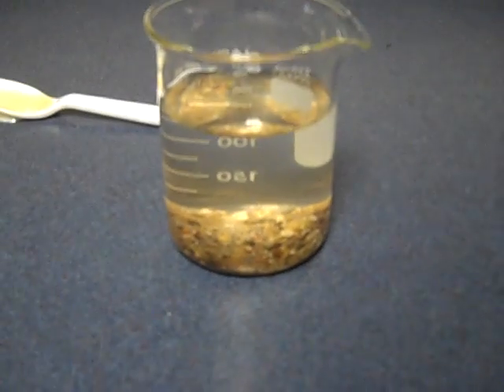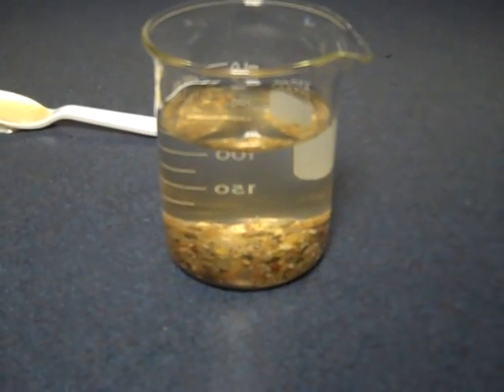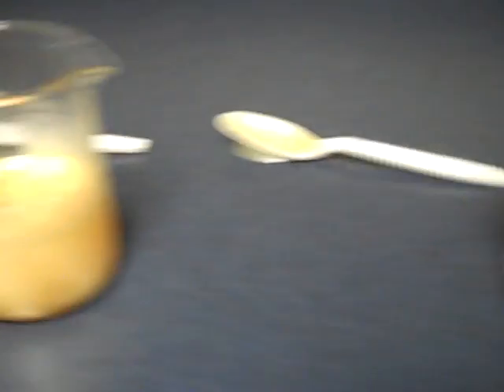Once you've decided that, you can determine if it's a suspension if there are particles that have settled to the bottom, such as this one. This beaker contains a suspension — it has large particles that sink to the bottom and they also scatter light.